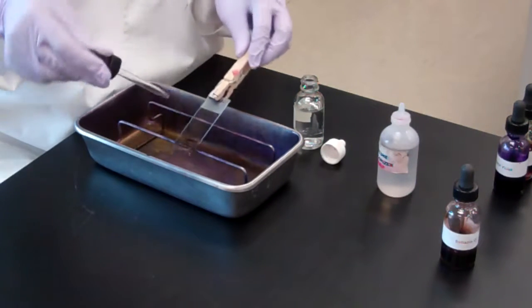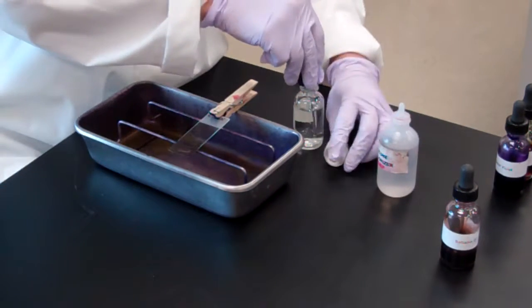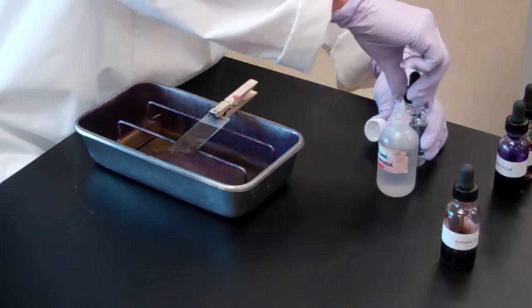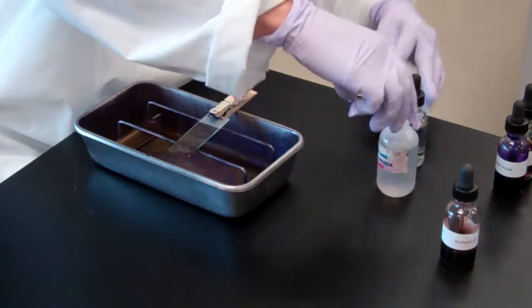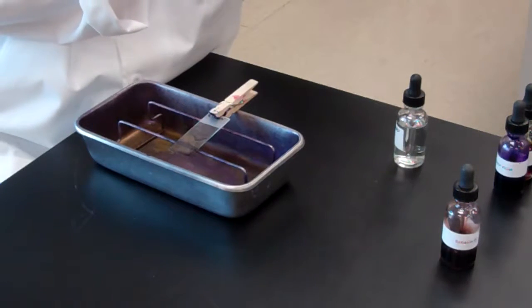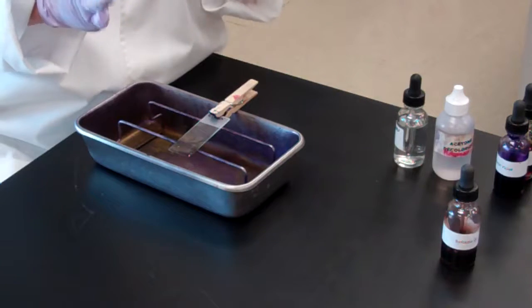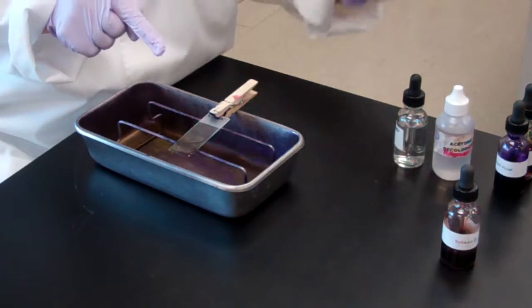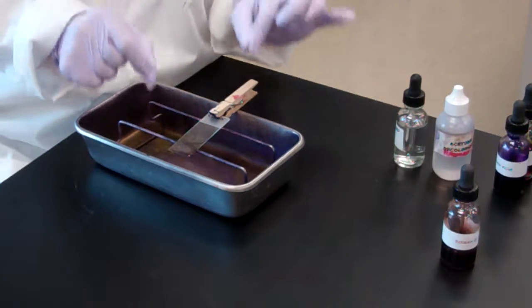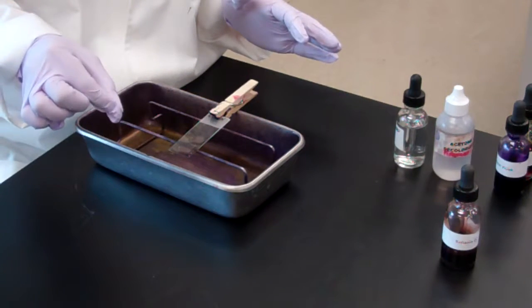If you don't wash it off fast enough, with the gram-positive bacteria you could possibly wash off the peptidoglycan, destroy that gram-positive bacteria and wash away the crystal violet. So, key note there is that when you add the decolorizer, you have your water available and ready to go to rinse off that slide.